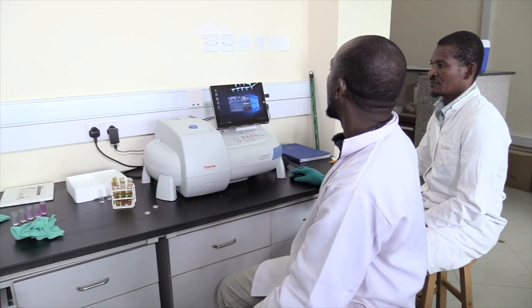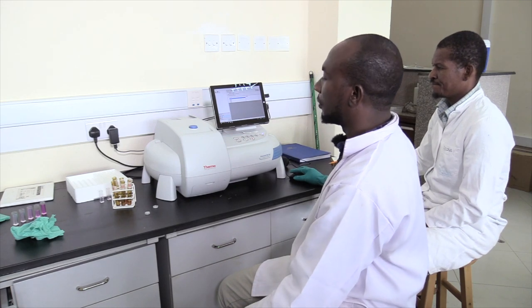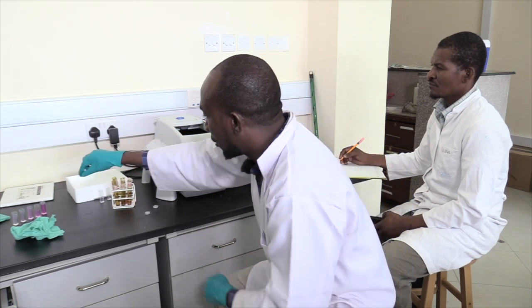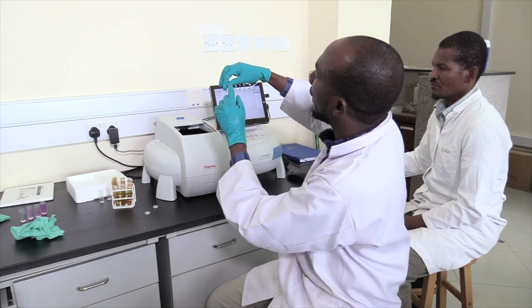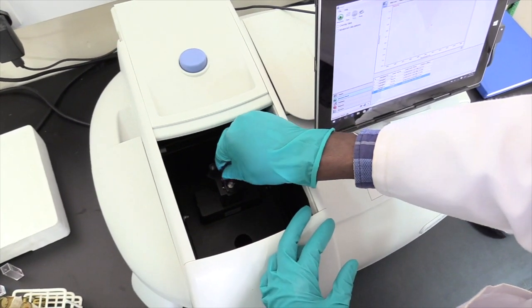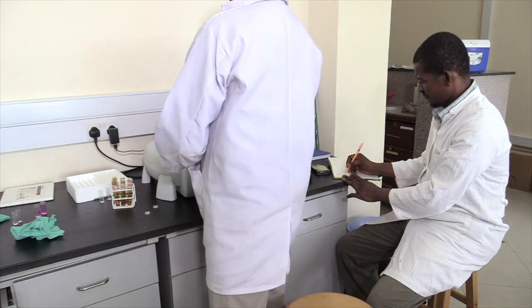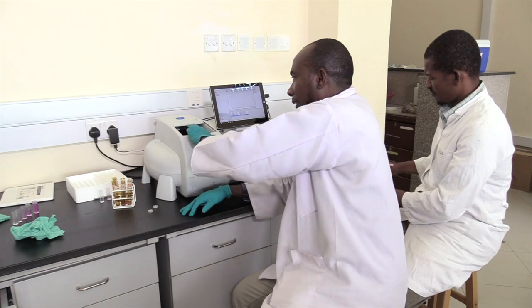We open our software — this is Thermo Insight. We create the methods according to the number of samples we have. Here we have our standards in five test tubes. Once the instrument is ready to measure absorbance, we put our samples in one after the other, making sure the clear area of the cuvette faces the light path. We click OK, and a reading of 0.319 absorbance is obtained. This is how we analyze nitrate using the spectrophotometer method.